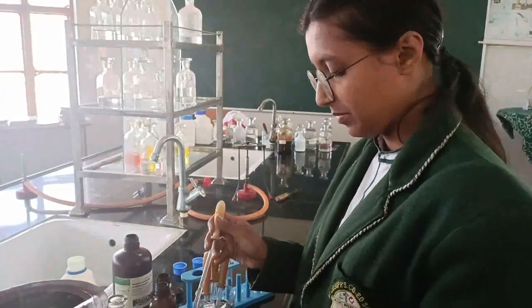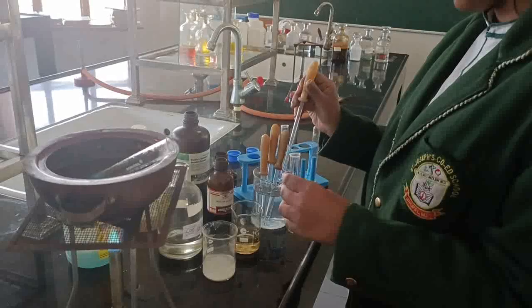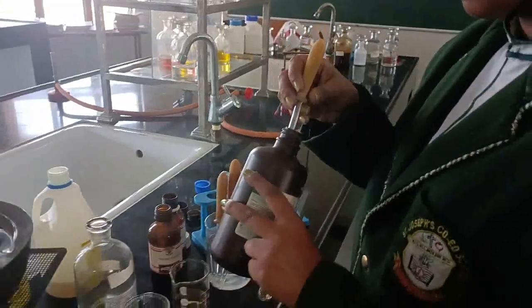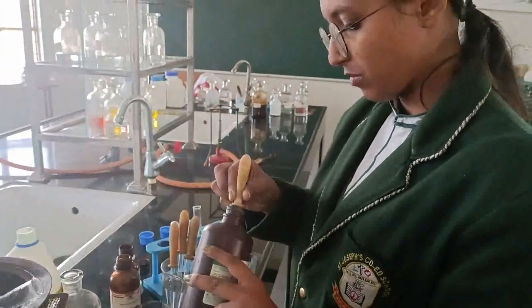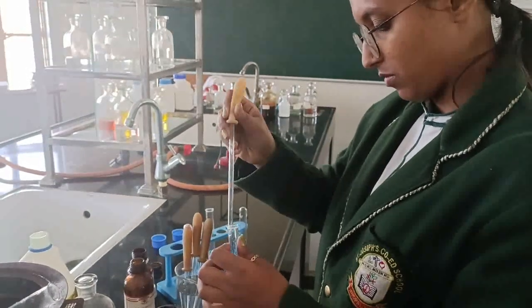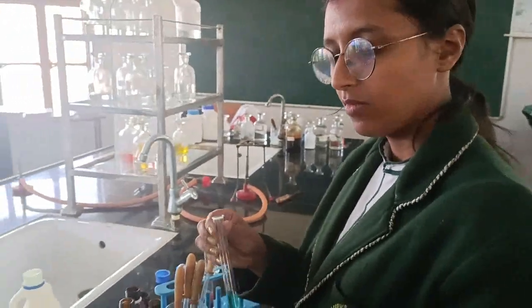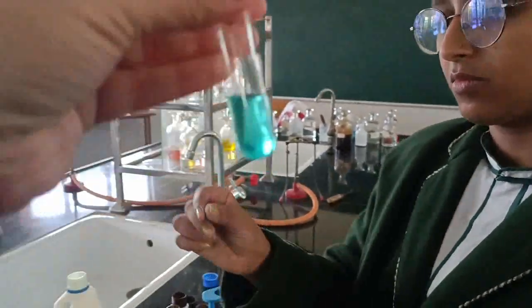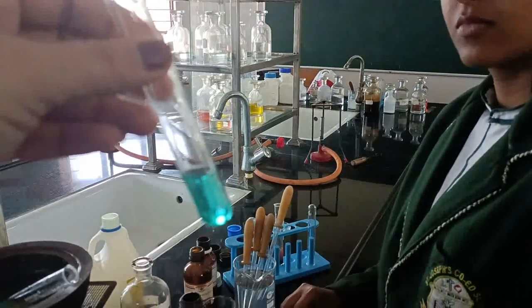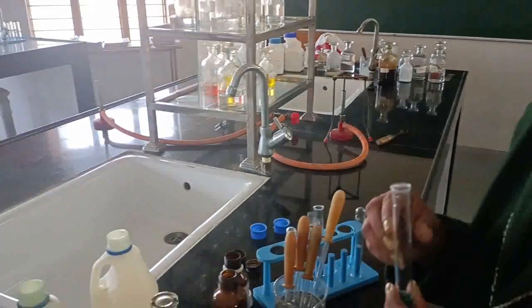Very good. Take again 1 to 2 ml of aqueous solution of the given sample in the test tube and add 1 to 2 ml of Benedict's reagent. Benedict's reagent is also readymade and available. Add it. Yes, 1 to 2 ml of Benedict's reagent she has added, and again this test tube goes to the boiling water bath. The difference between the Fehling A and Fehling B solution after adding to carbohydrate was deep blue. This is sky blue. We'll be keeping them one by one so that there is no doubt.